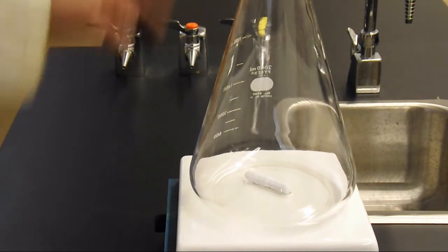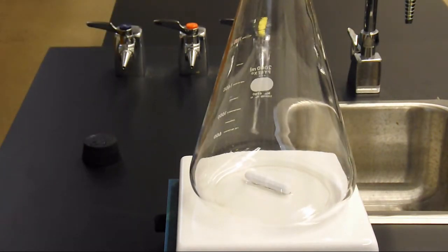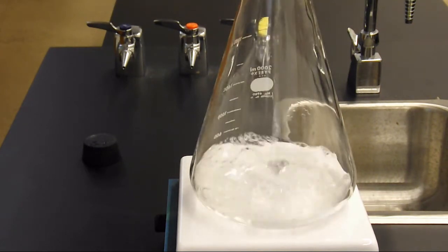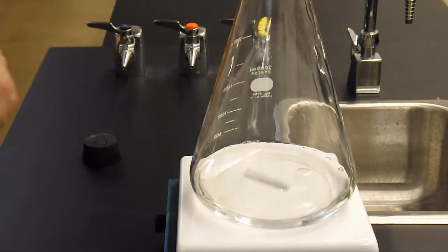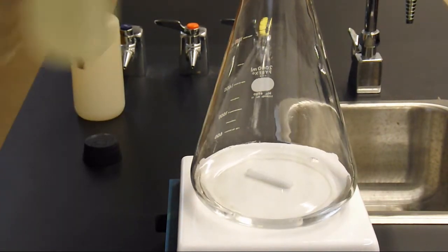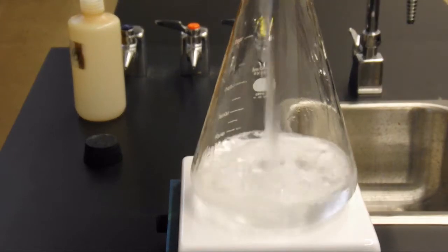So let's look at this and then we'll look at the mechanism associated with it. First we have a clear colorless liquid, and to that we're going to add another clear colorless liquid.